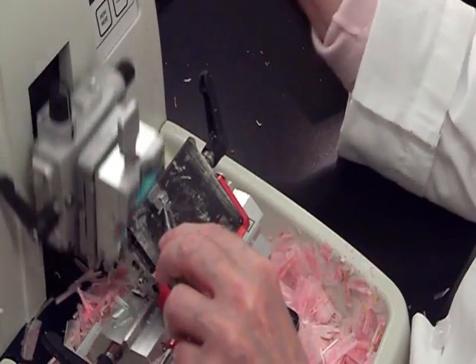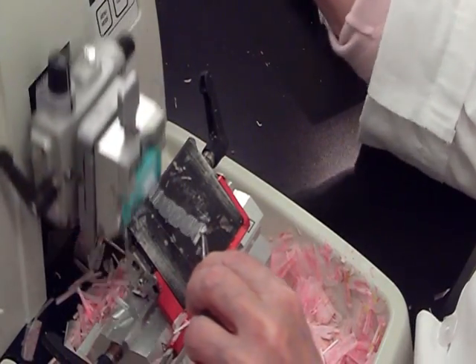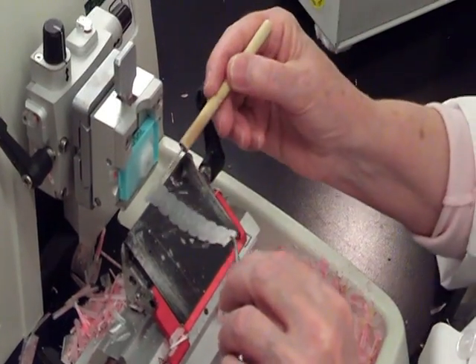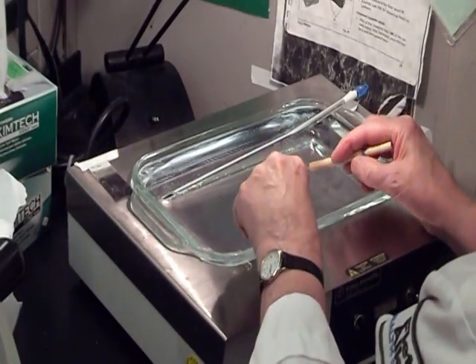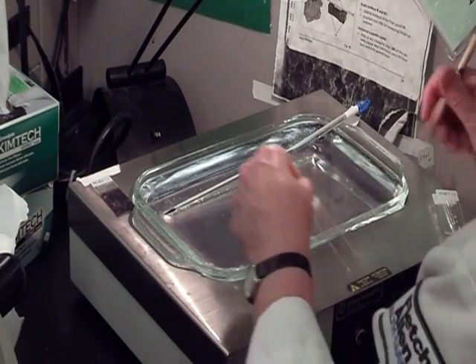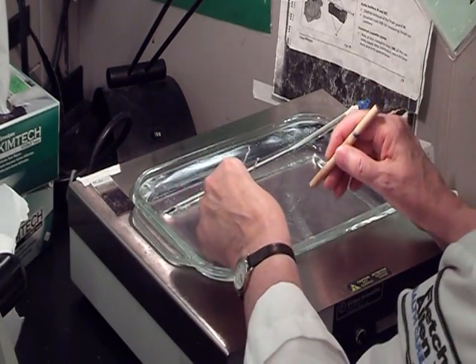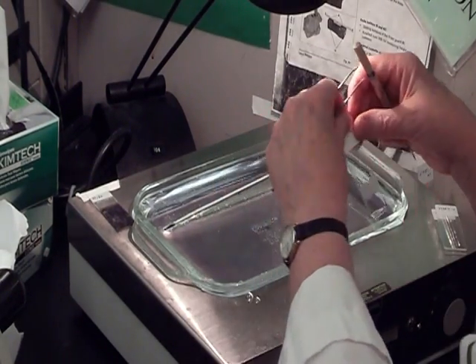Paraffin blocks are cut using a microtome to produce a ribbon of tissue sections four to five microns thick. This ribbon is floated in a bath of warm water. The histologist chooses the best section and transfers it to a slide labeled with the patient's specimen number.